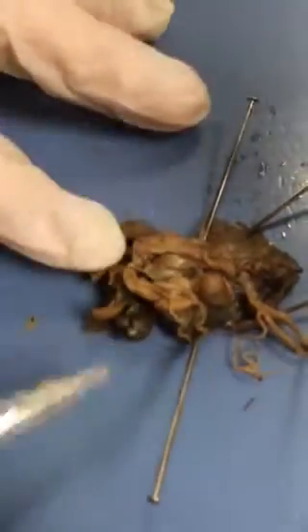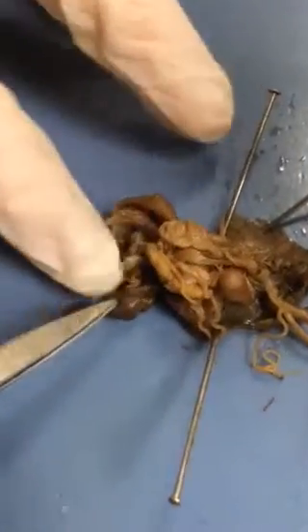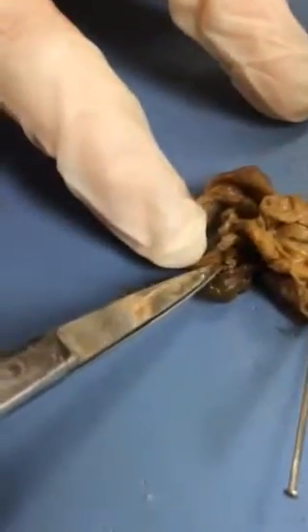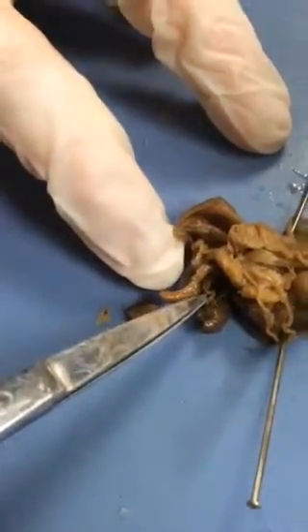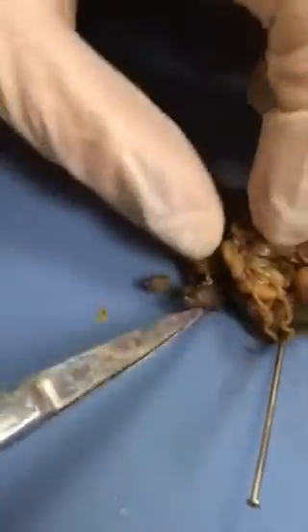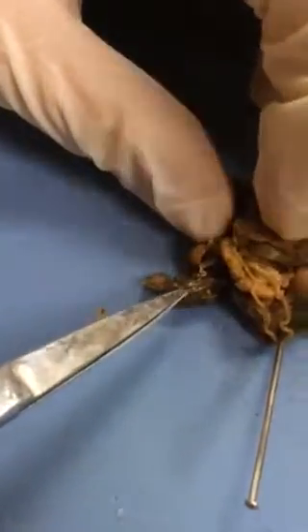And then you move down here to these ball-like things, and these are the hermaphroditic ducts, which leads right into the ovo testes, right here.